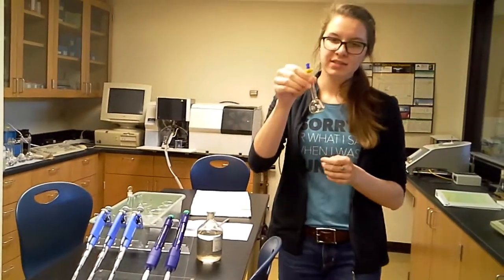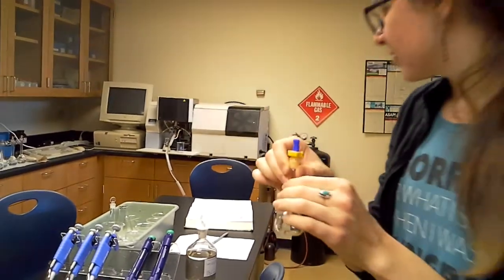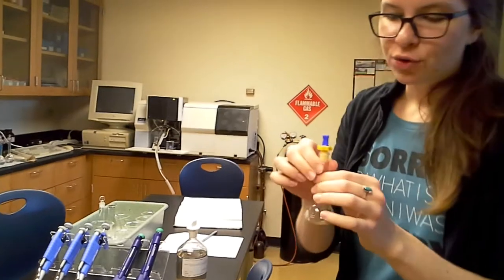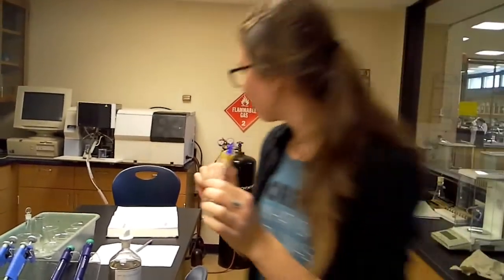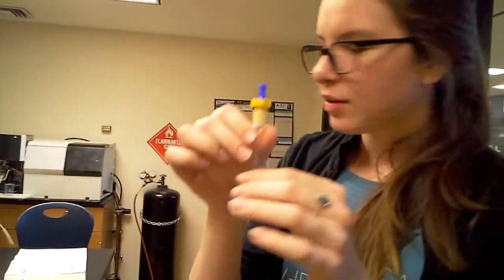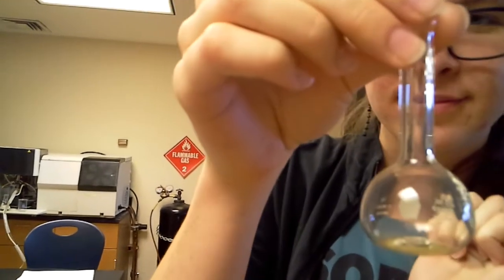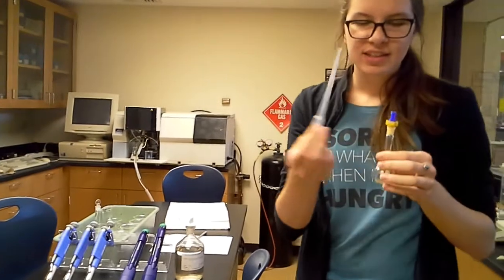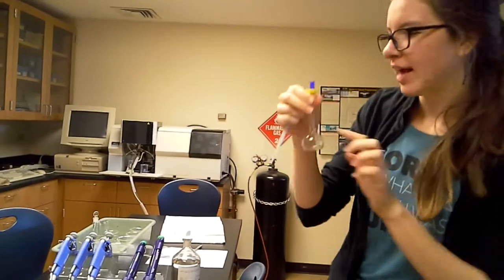Now, the volumetric flask is right here, and it'll fill up a little bit with the sodium silicate, and the rest you need to fill up with iron chloride, I believe. Yep, iron chloride. So a little bit of sodium silicate, which you'll determine from your micropipette, and all the way up precisely to the line with iron chloride. Now you'll be having this little guy right here to add your iron chloride so it's exactly precise. You want a very precise measurement at that line.